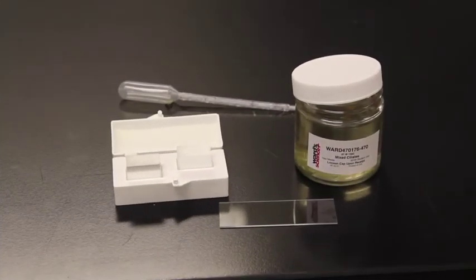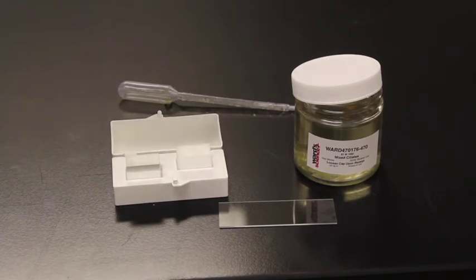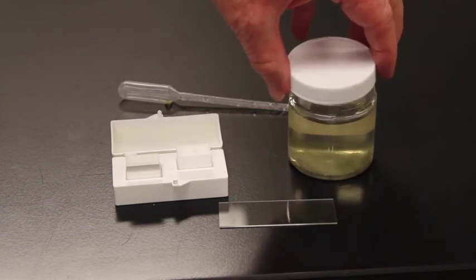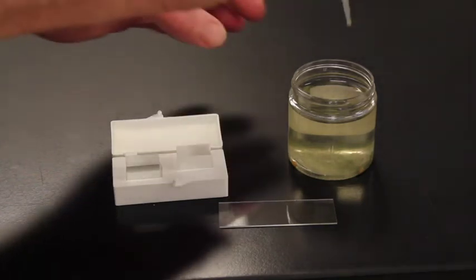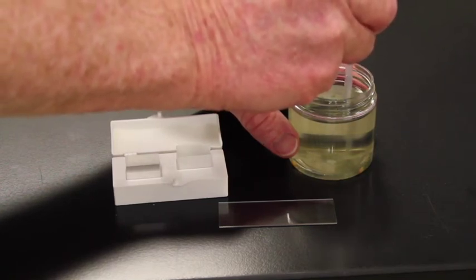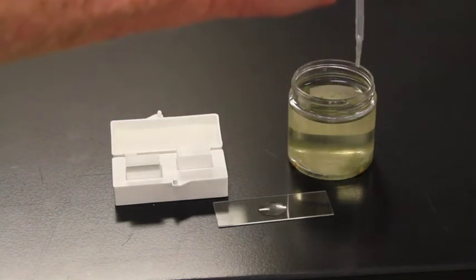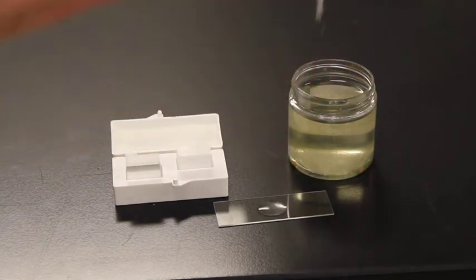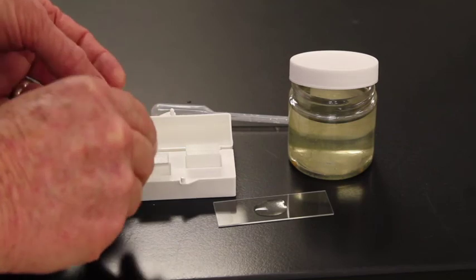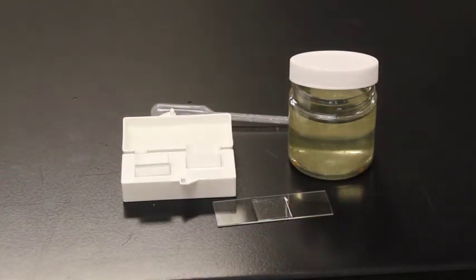The next wet mount I want to make is of what are called ciliates. Ciliates are different from amoeba in that they move by cilia rather than pseudopodium. Here's my culture of mixed ciliates from Ward's Biological Supply Company. These organisms are heterotrophic, so they're hanging out in the bottom debris. I want to carefully suck up the muck off the bottom, drop a few drops onto a slide, and then get a cover slip. Be careful not to get more than one cover slip. Our wet mount is ready to be viewed.